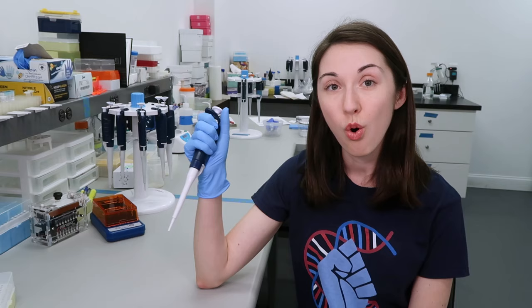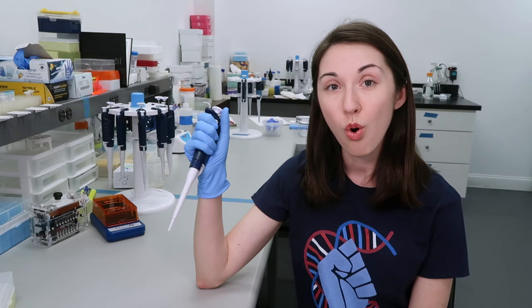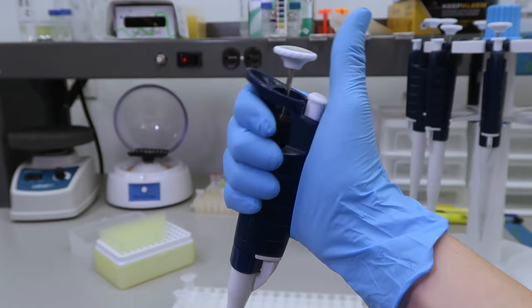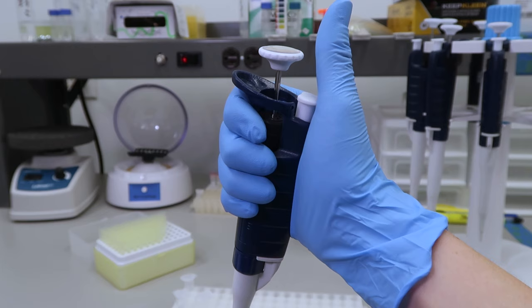One of the most comfortable ways to hold a pipet is like this, with the pipet resting in your palm and the finger rest positioned over your index finger. This allows your thumb to comfortably control both the plunger and the ejection button.